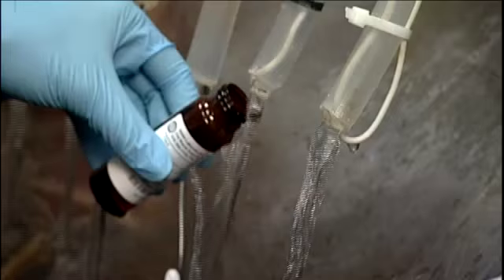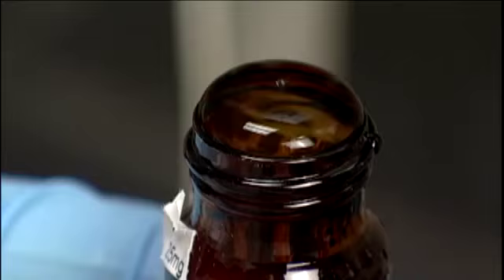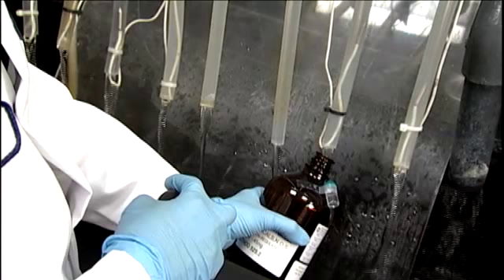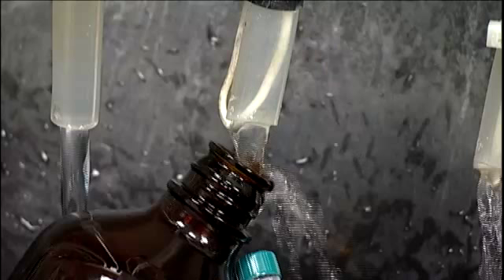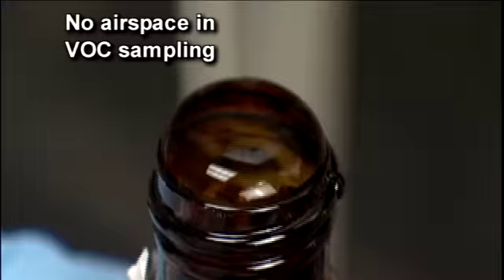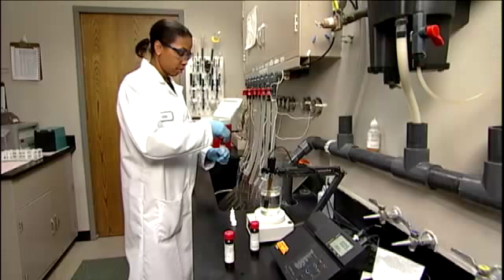When sampling for volatile organic compounds, the bottle should be filled to the very top so there is no air bubble or headspace, which would cause the loss of volatile compounds. The sample should be headspace-free. Conversely, when sampling for semi-volatile or nonvolatile compounds, headspace or a small volume of air at the top is allowed. There can be airspace in semi-volatile or nonvolatile compound samples.